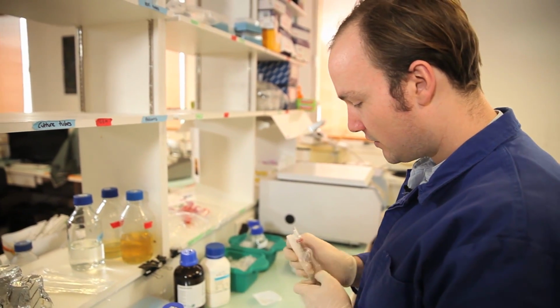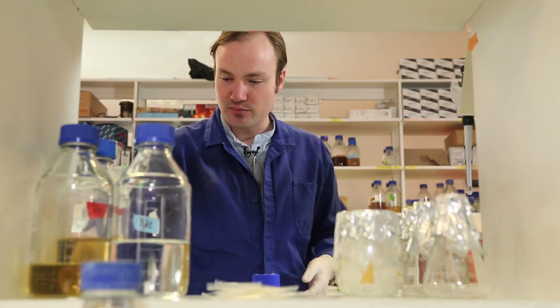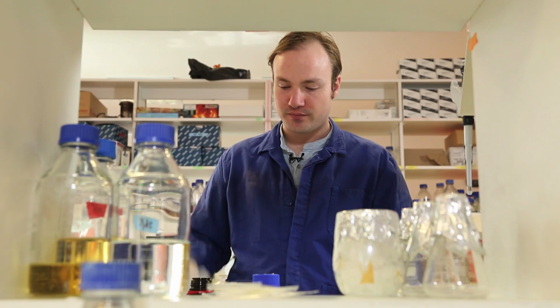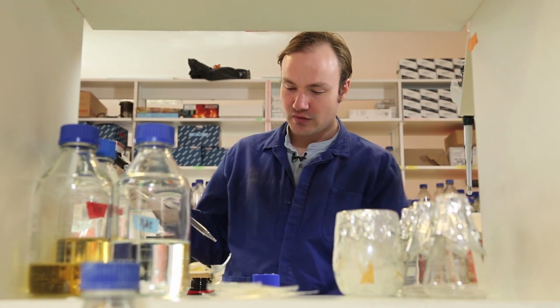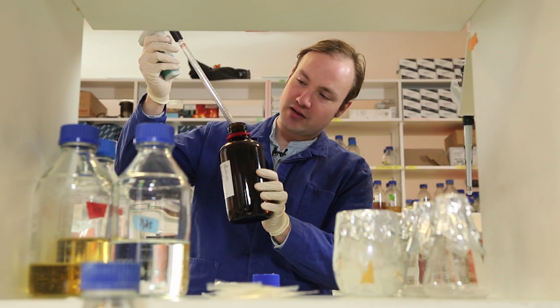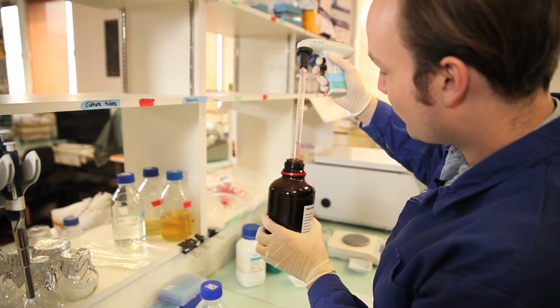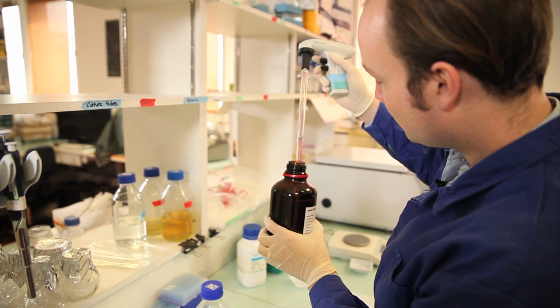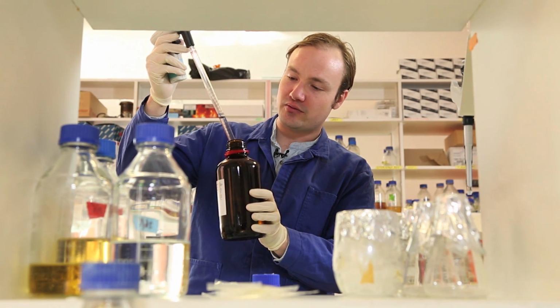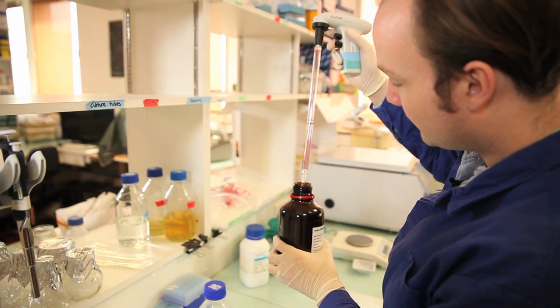For this, I'm using 100% glycerol solution, and it can be really a pain to pipette, so I'll have to be extra careful. One tip here is to put just the tip of the pipette into the glycerol, because otherwise the entire pipette will be coated with glycerol. Be a little patient to get exactly the right level. Let the excess glycerol drip off.